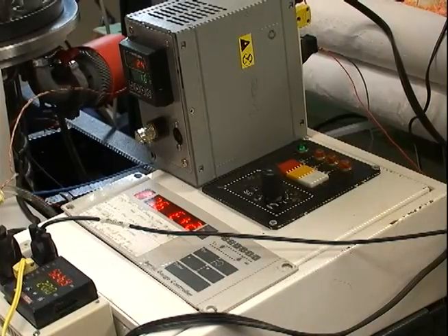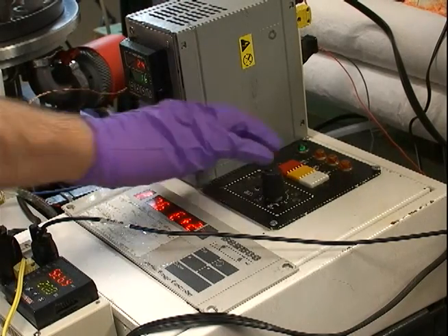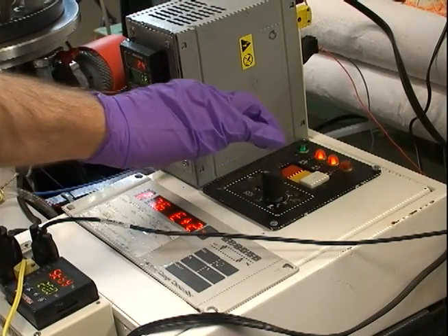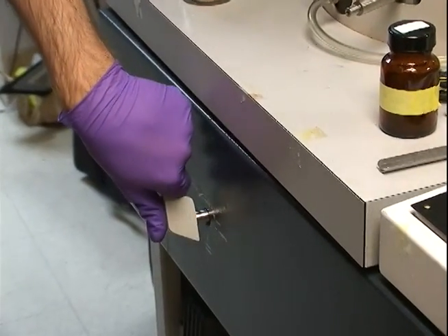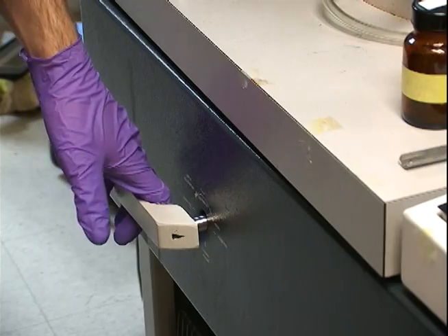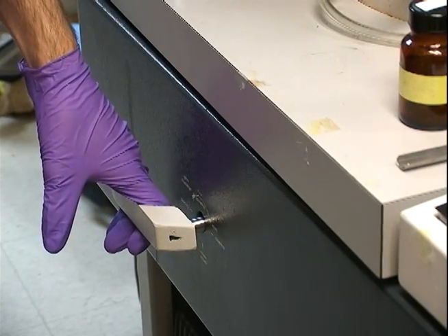In order to start lowering the pressure, the diffusion rotary pumps are turned on. Pump two is turned on and the pressure begins to lower. The pressure will go to about 1 × 10^-1 torr.